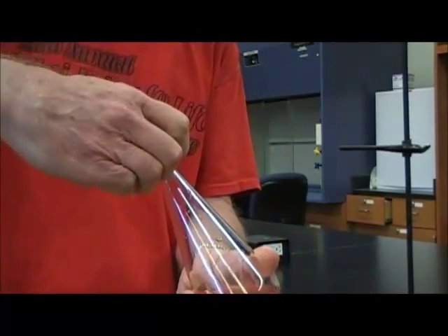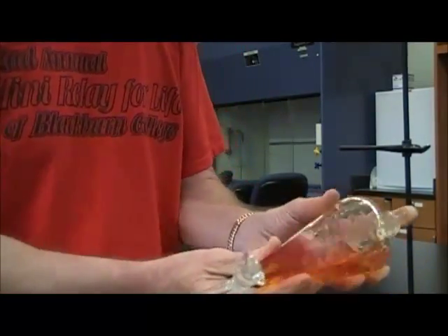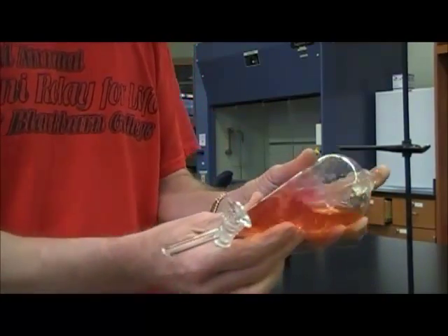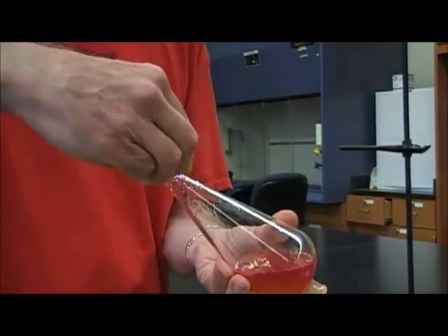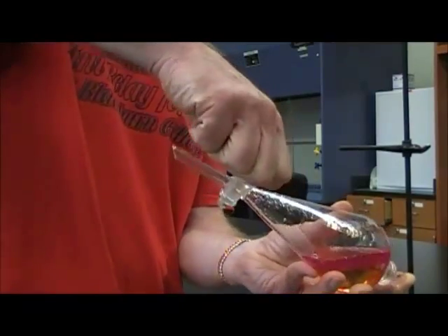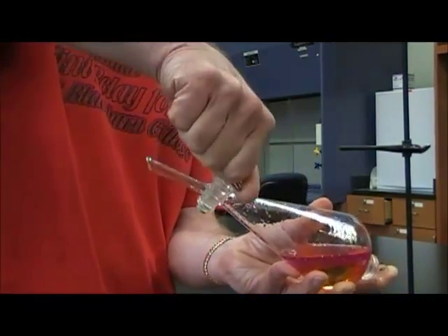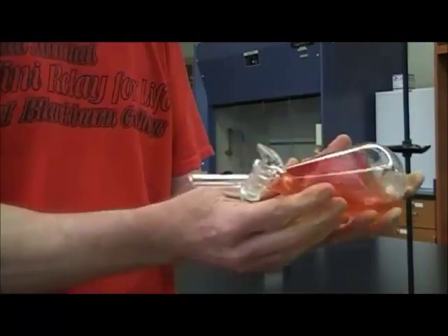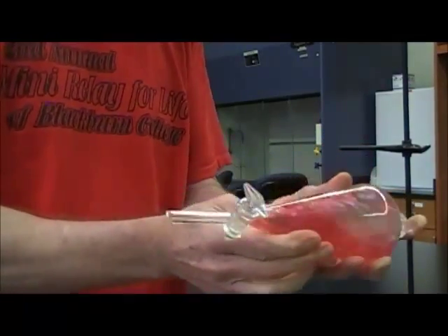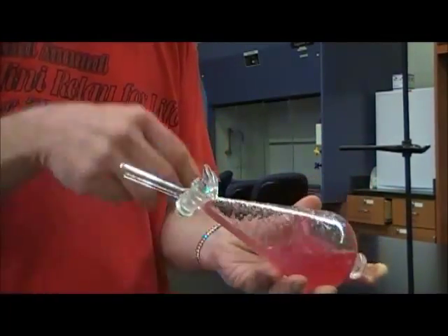So now, close the stopcock again. Again, shake a little bit. Open the stopcock, just to relieve any pressure, and we'll do it again. Make sure that the solvent gets good contact with the water layer.